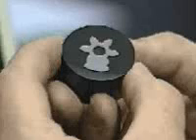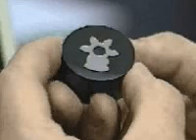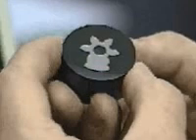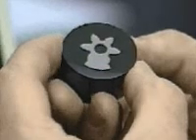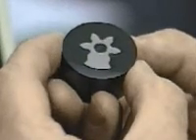Carefully section and mount the test specimen in a suitable medium to allow for ease of handling and polishing. A mounted and polished specimen is shown here. Care should be taken so that the true area fraction of the porosity is revealed throughout the entire cross-section.